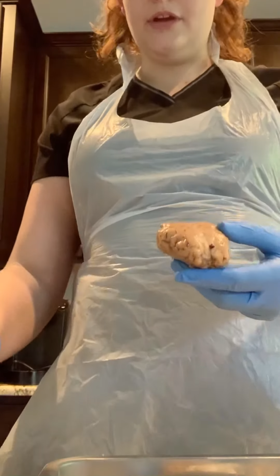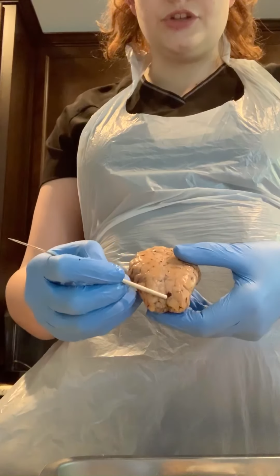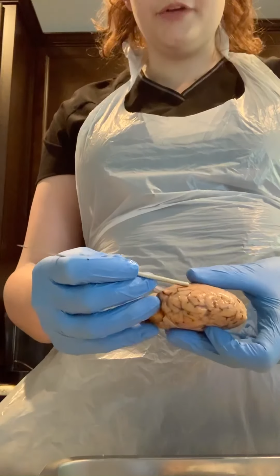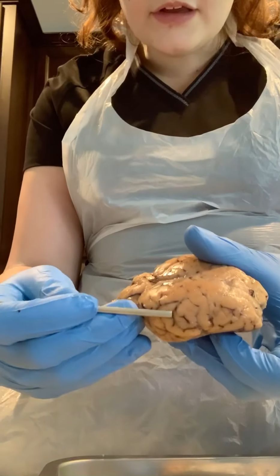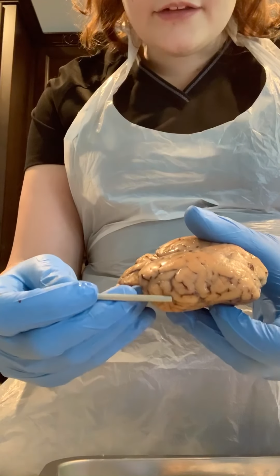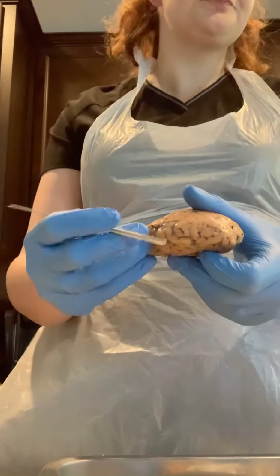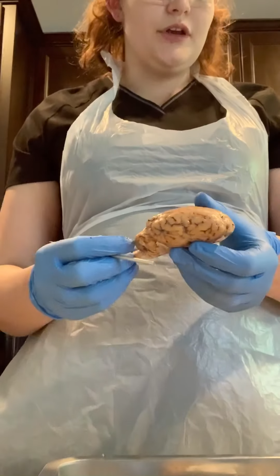Going down the middle of the brain is the longitudinal fissure. There's also the gyri or gyrus of the brain, which is the fold, or the kind of folds. And then the black dark looking spots here are the sulcus or sulci, the indentations on the brain. There are 2 sulci that are very important.